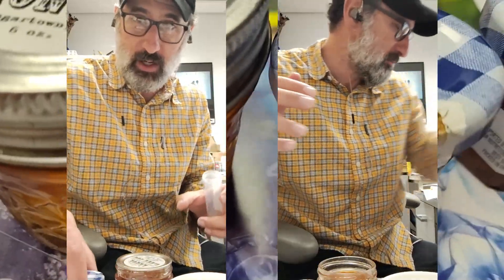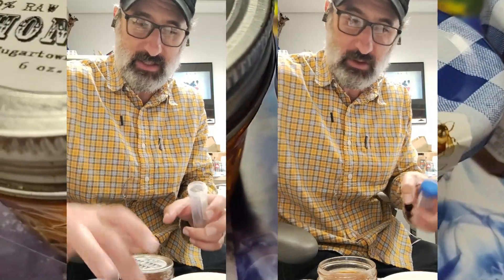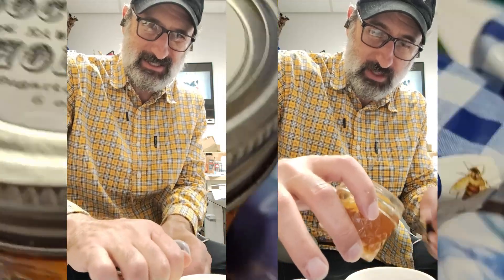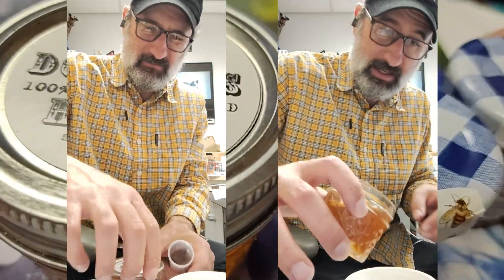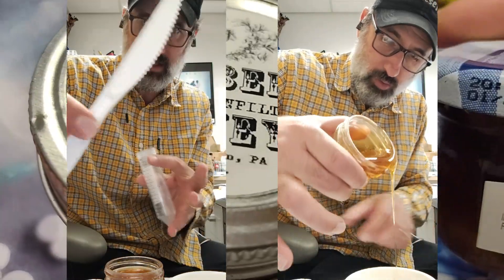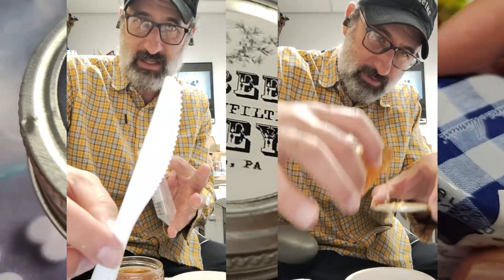I'm going to get honey everywhere. We got the Bonne Maman, we got the Dockbeez. These containers — I'm just going to spill honey everywhere, but then I'll wash my hands. Dockbeez, sticky lid. I did already taste some of this honey. It's quite good. So I'm just going to goop some of the honey — it's going to be impossibly dirty with this knife.